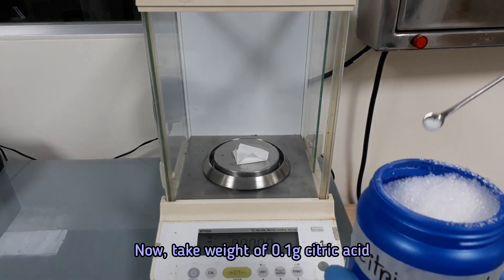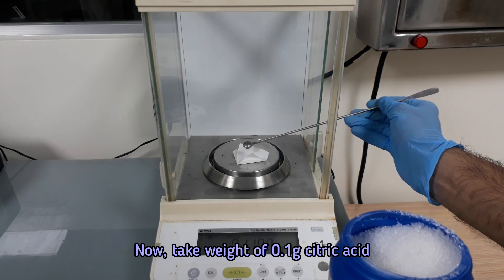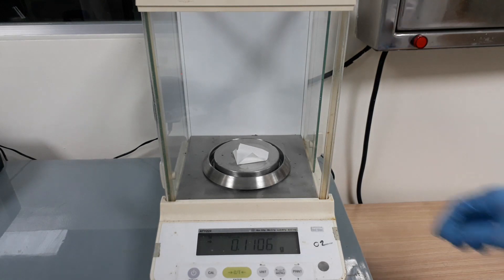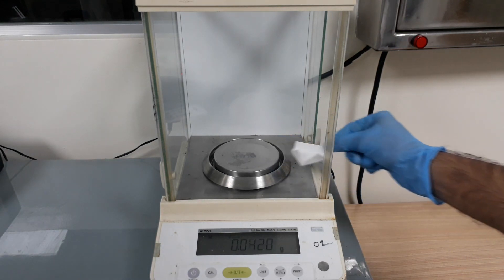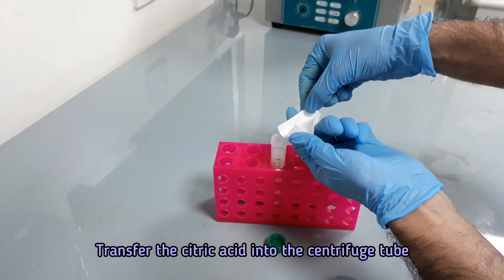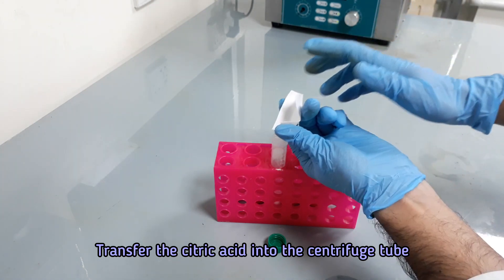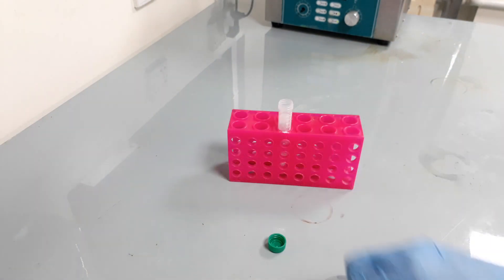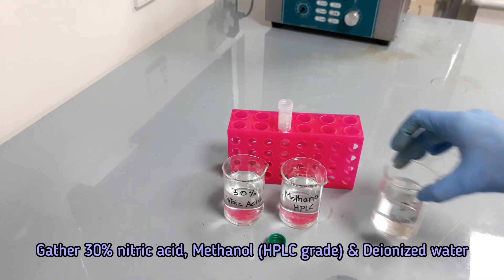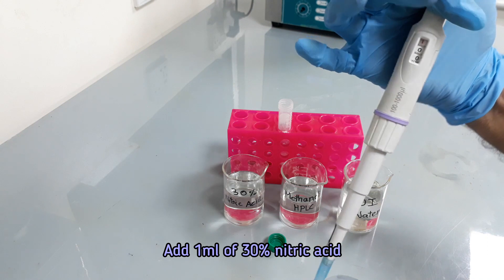Take a weight of 0.1 gram citric acid and transfer it into the sample tube containing the sample. Now add 1 ml of 30% nitric acid.